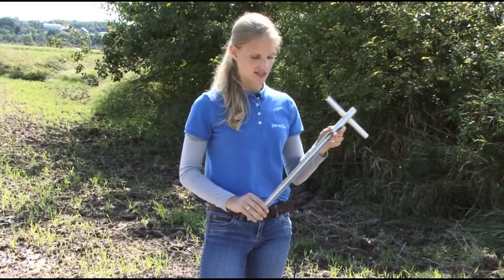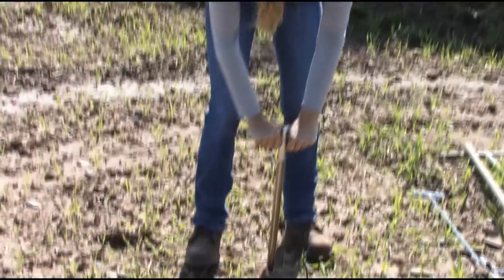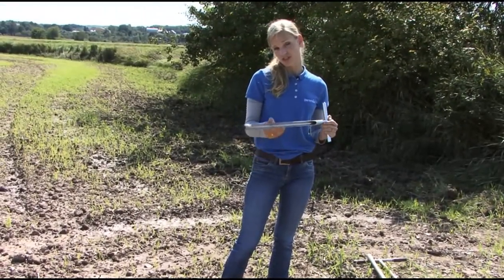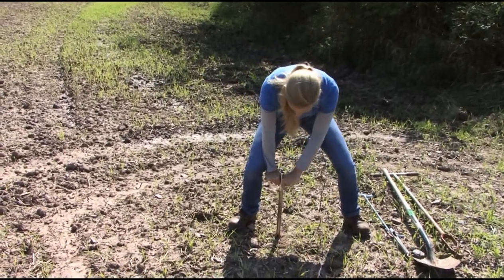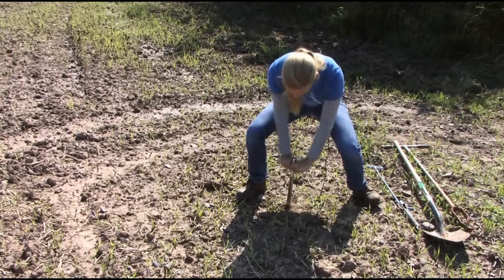One that you'll often see is this simple soil probe. It's just a tee where you're going to push it into the ground. For this field, because it's been plowed, we're going to go in 15 centimeters and take your soil sample from a 15 centimeter depth. The problem with these probes is, on harder ground, it's sometimes hard to get them down and get an actual proper sample.